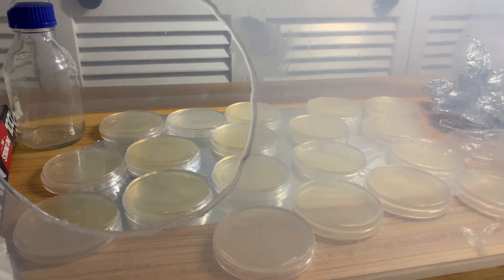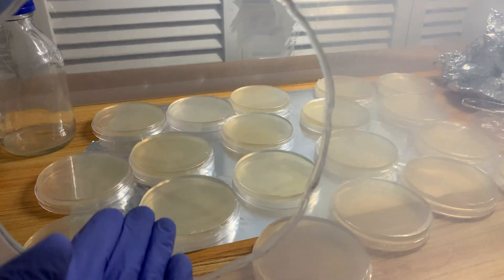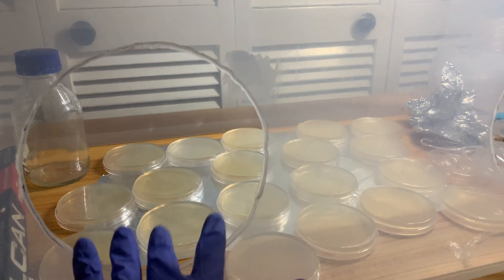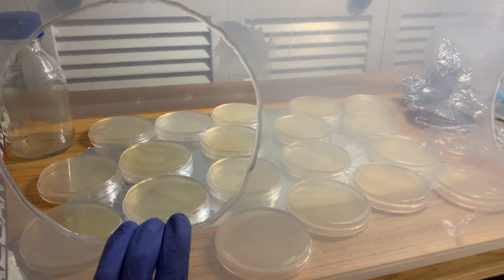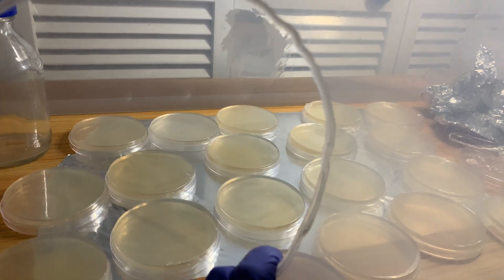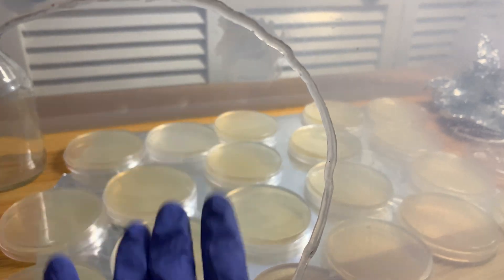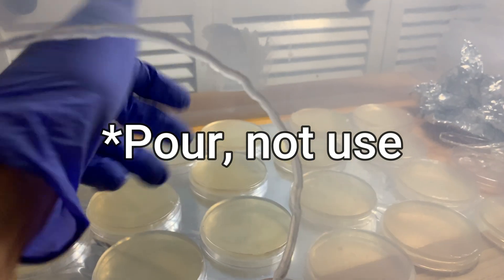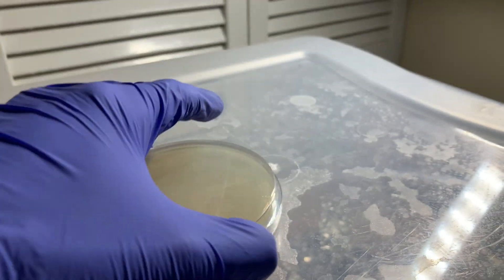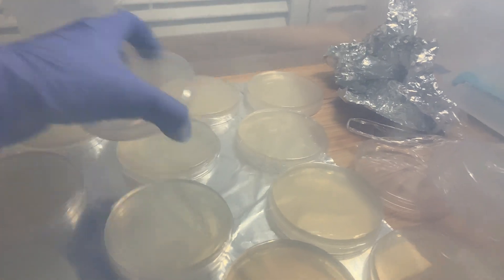I am back — it has been about a day and a half since I poured these plates. Everything went well and went to plan. As you can see they're still in the still air box, because I want to show you how they look right now. This is not how I usually store my plates — I don't spread them out plate by plate, I stack them. The reason they're spread out is because I sprayed each plate front and back with hypochlorous before placing it in the SAB and stacking them.